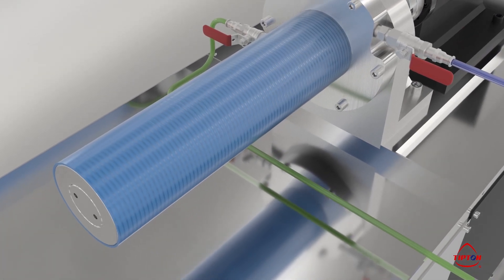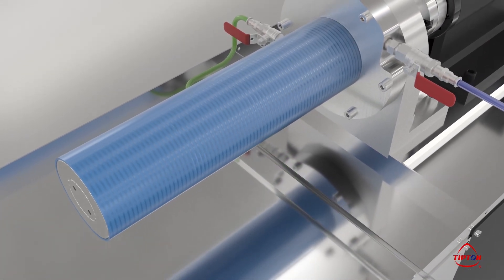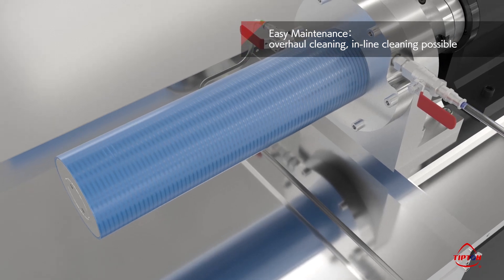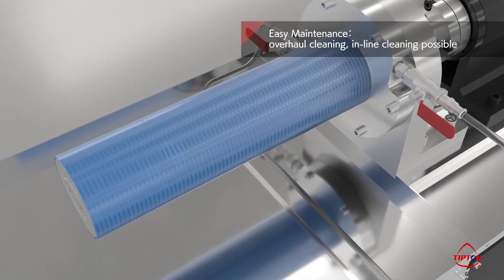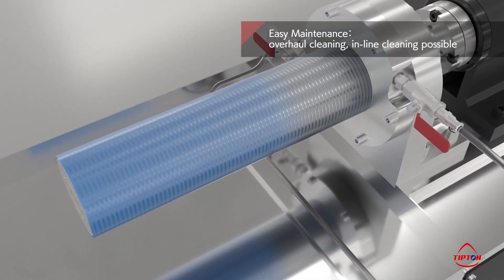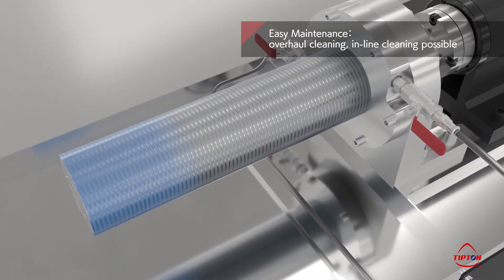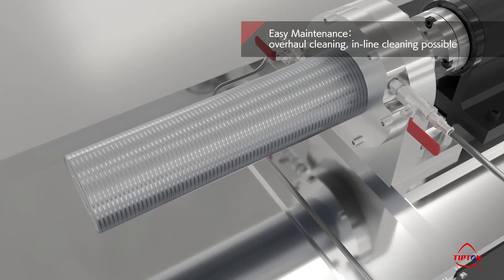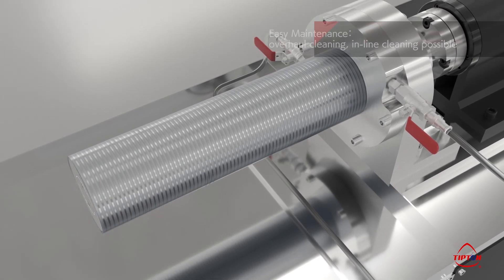In-line cleaning using Taylor Vortex is also possible. Simply push the cleaning liquid from the inlet to the outlet to thoroughly clean the entire gap space.